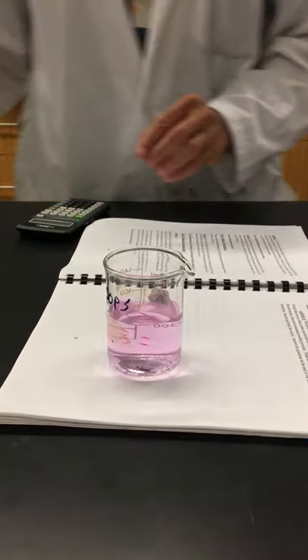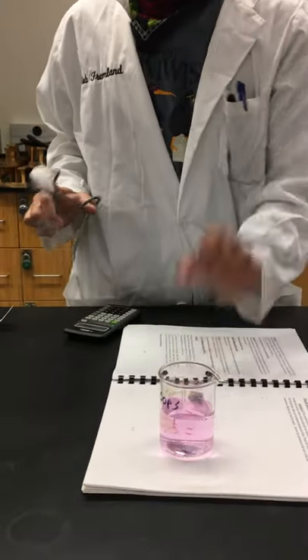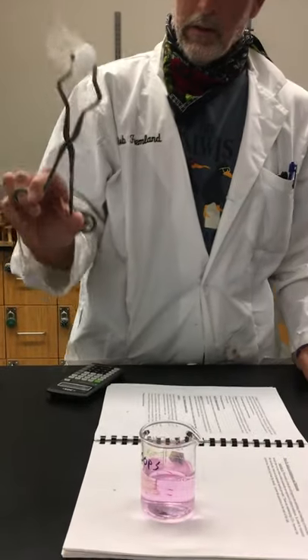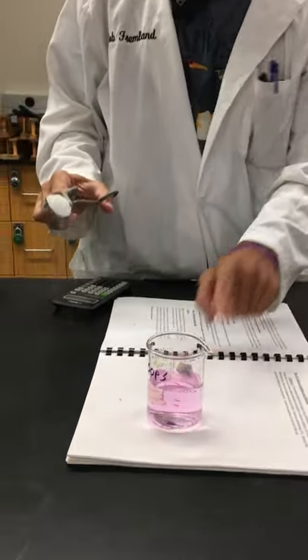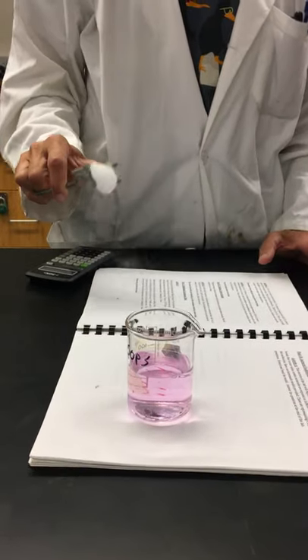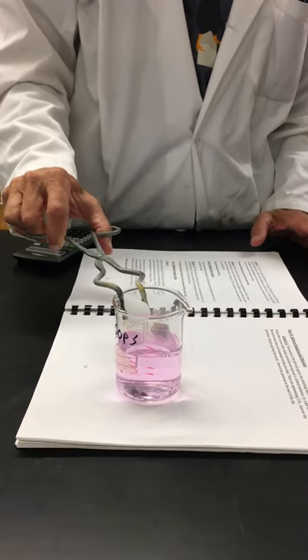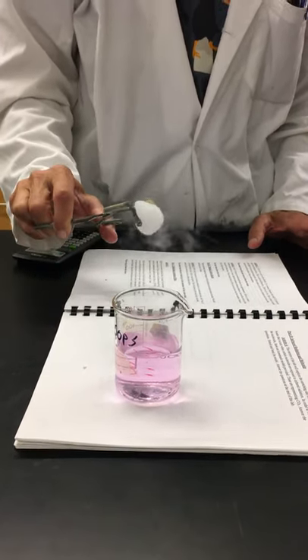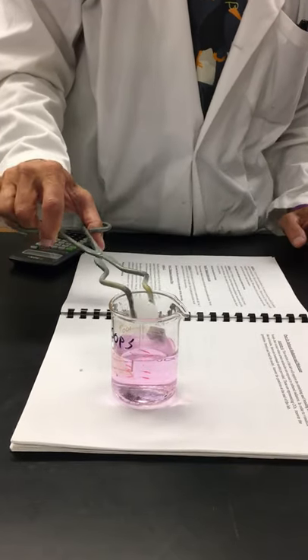Now, what I'm going to do is take a piece of dry ice and put it in here. This is only pink because there's base. So this is dry ice, carbon dioxide, and water — so the reaction will be carbon dioxide and water — and watch. Notice at no time do my fingers leave my hands.